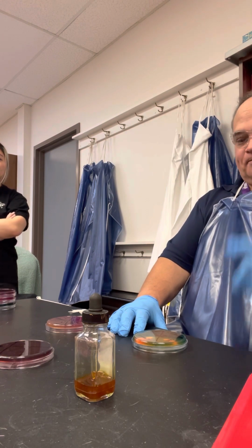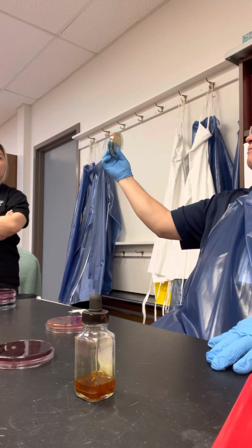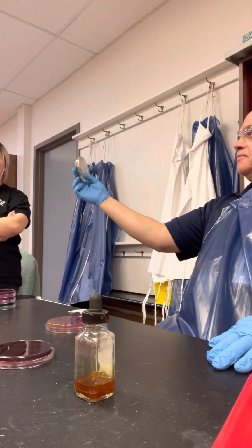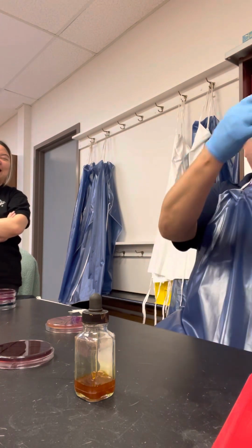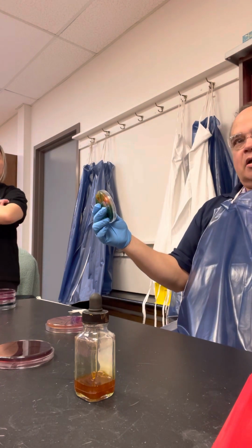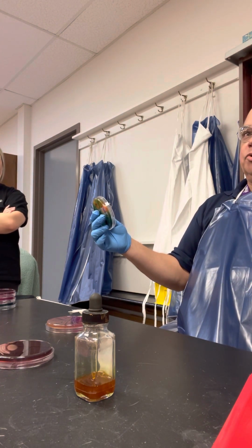Fermentation for that one. Used to test stools. Poop! All right. So if they're yellow or orange, do we care? No. Alex, do we? No, we don't care. Because the pathogens that we worry most about are Shigella and Salmonella, and both of those are lactose non-fermenters.